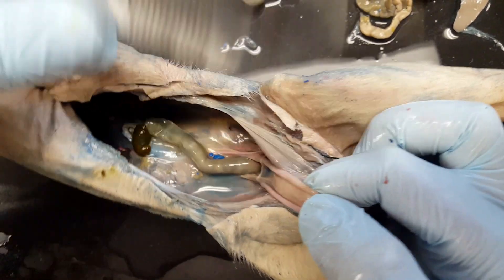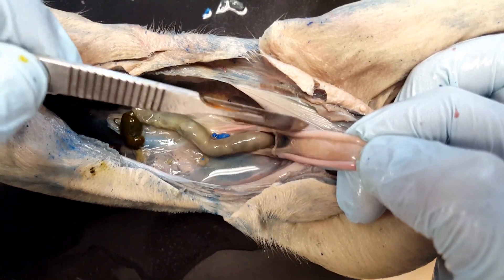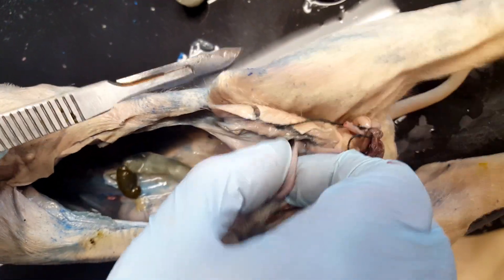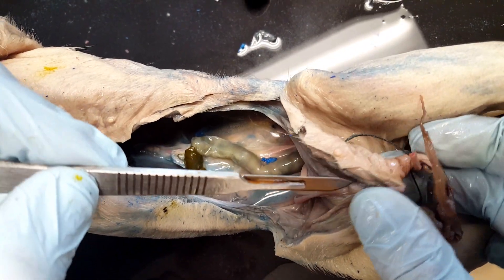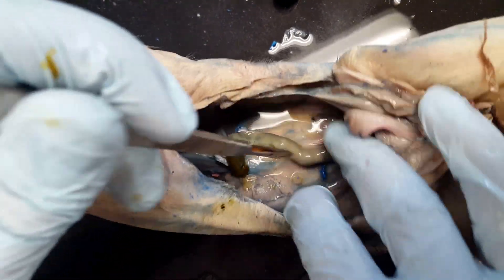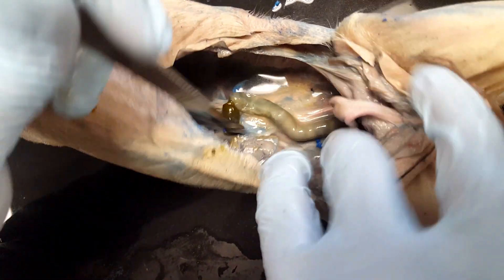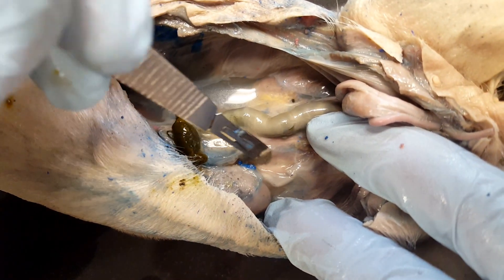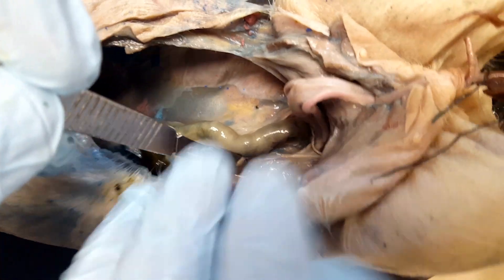Now if we examine here, we can see the bladder in the middle, with two umbilical vessels on either side. If we were to follow the bladder down, we would see that it ends in a tube — that's going to be the urethra that leads out the penis, in this case because it's a male. If we remove the protective covering from the kidneys, we'd see there is a tube right here from the kidney. That tube is going to carry urine from the kidney into the bladder.